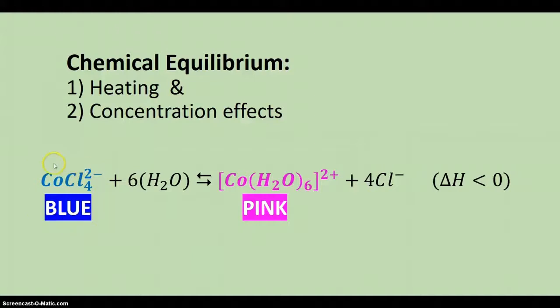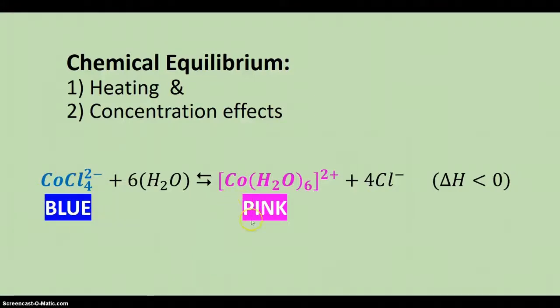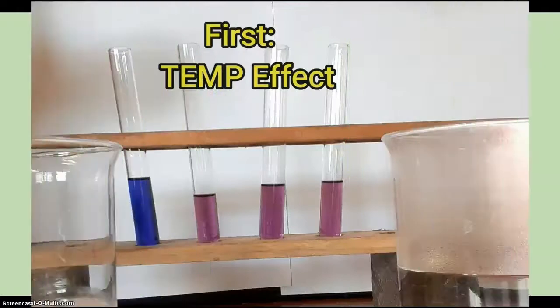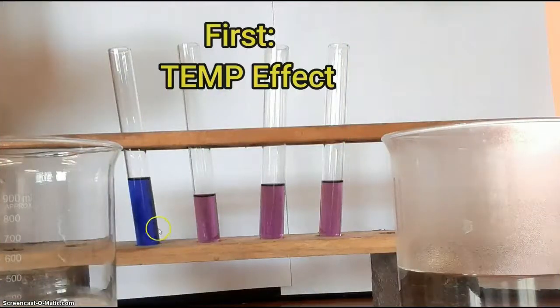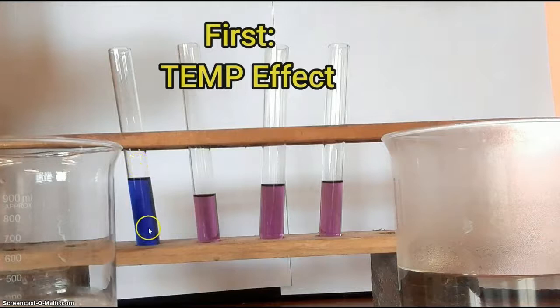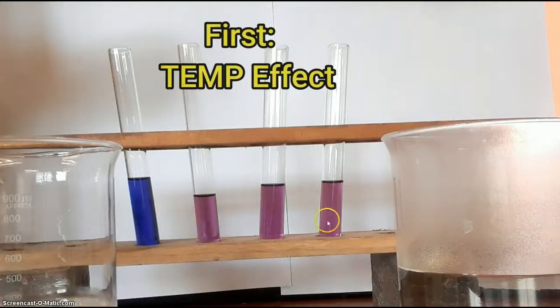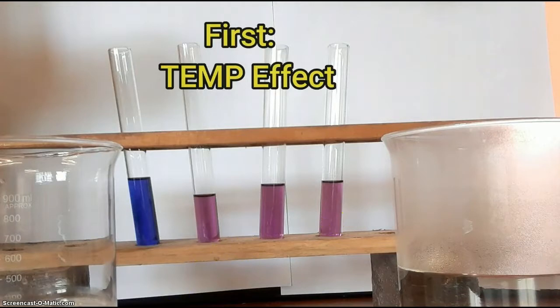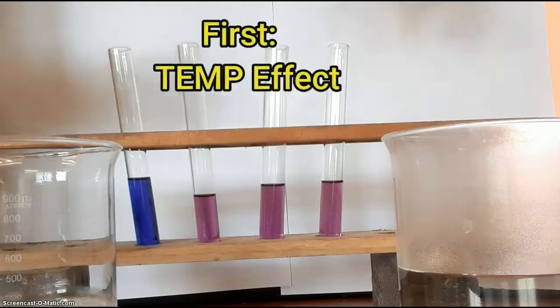Cobalt chloride is blue in this form whilst it is pink in this form. First we're going to look at the temperature effect. Here we have some cobalt chloride in pure alcohol — it's blue — and to these three we've added a little bit of water to make it go a purplish color.